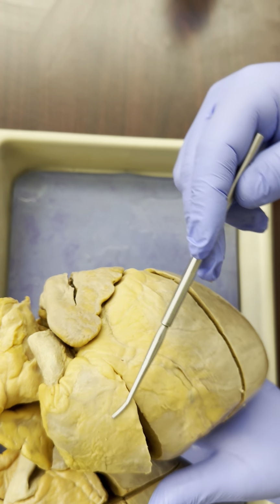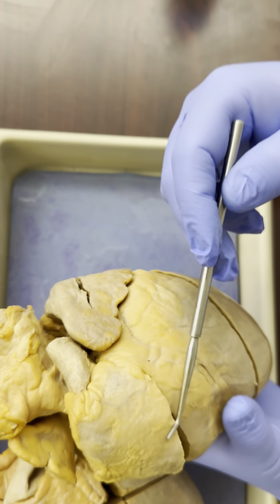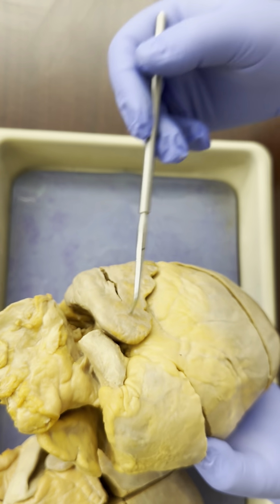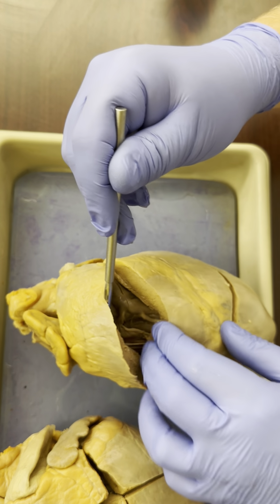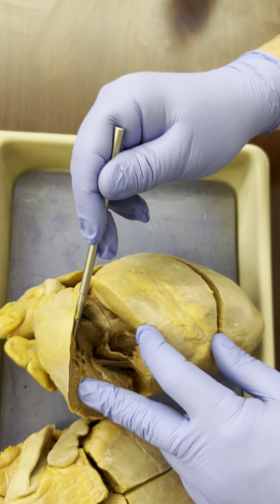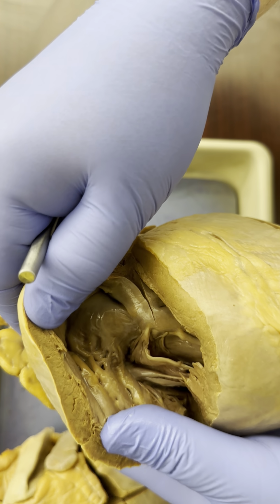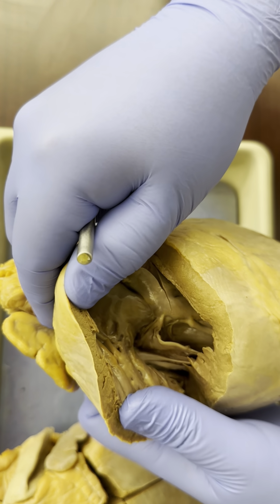Now, right below those, the atria are the receiving chambers. They pass blood into the ventricles, the ejecting chambers. So just below the atria, we find the ventricles. So here we saw just a moment ago when we were orienting ourselves, this is the right ventricle. I'm opening it up, and you can see here the wall of the right ventricle. It's pretty thick, but it's nothing compared to what we see on the left ventricle in a moment.